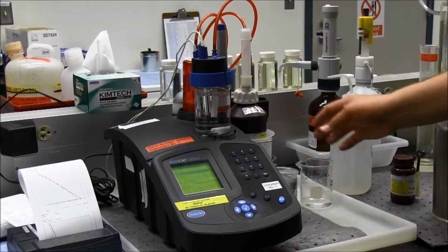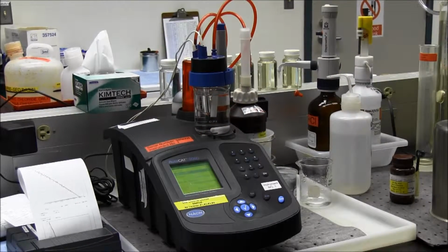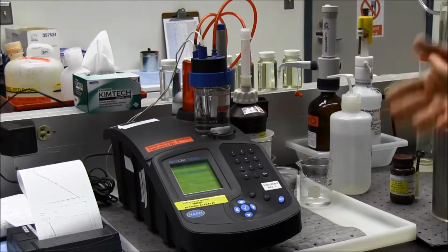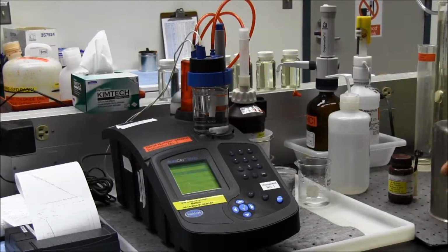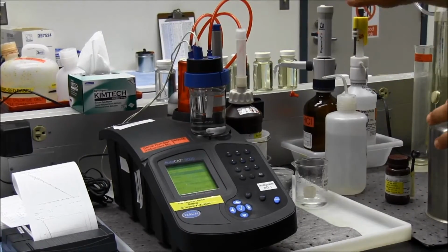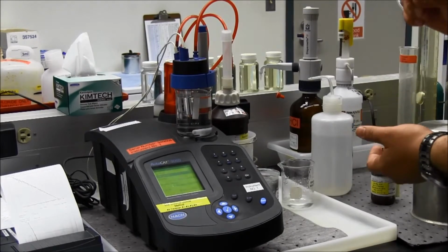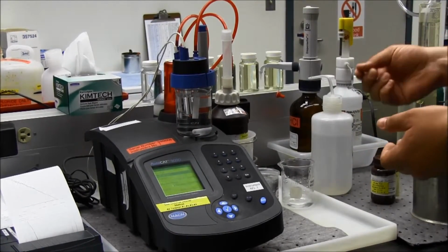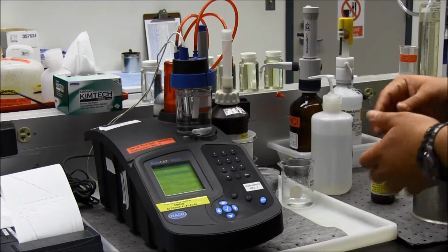The other one would be glassware, you really need to make sure your glassware is really clean, you don't have any iodine left over in that, because that will throw off the results of the test. And then the third one that is also very important is that your acid and your phosphate buffer, you make sure that you purge those also, because if you only get a half of a dose of the phosphate, you could throw it off, or the acid, the same thing.